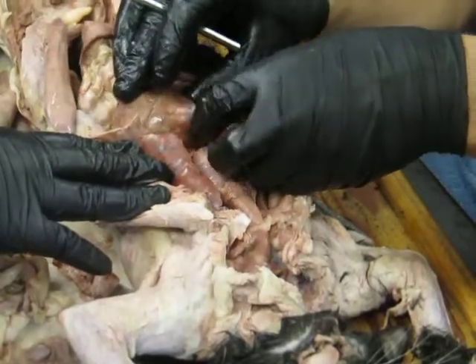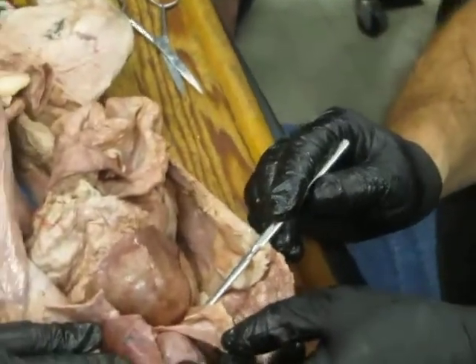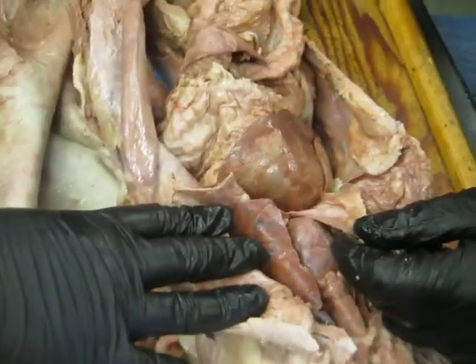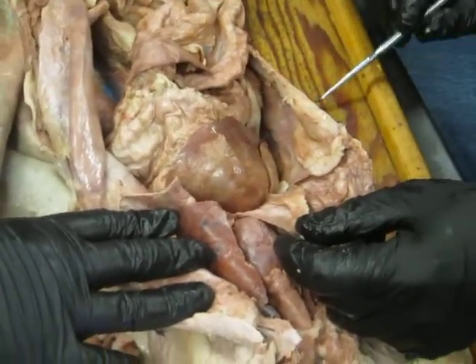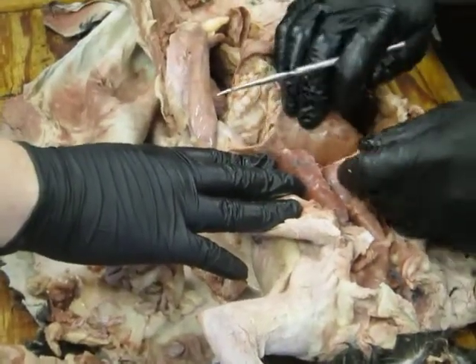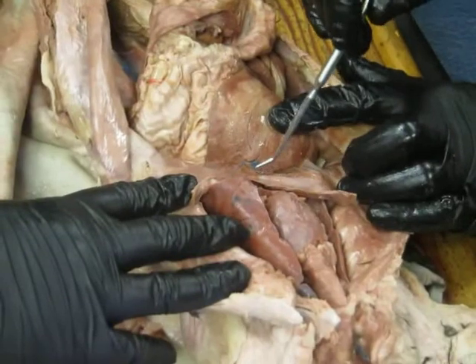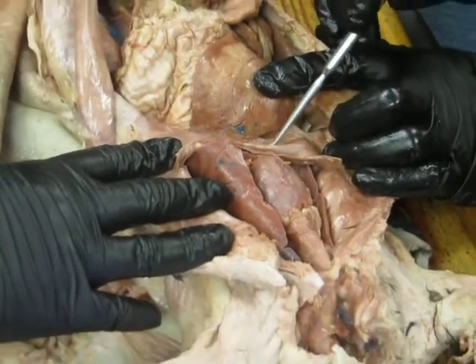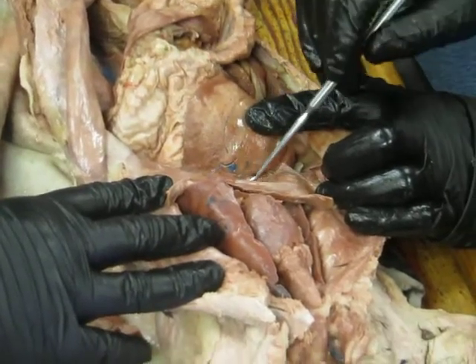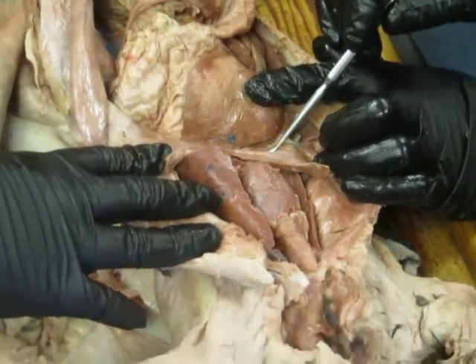Liver, and you can see this membrane that connects the liver kind of to the diaphragm and the ventral body wall right here, and that would be the falciform ligament. And I'm going to mention this because someone had asked me about it earlier. You'll see the term coronary ligament, and that's a little confusing because it's hard to figure out exactly what it's supposed to be. It's basically just the place where the visceral peritoneum covering the liver wraps around to the parietal peritoneum on the underside of the diaphragm. And so you can see there's a connection between the diaphragm and the liver that's basically made of a mesentery, and that is the coronary ligament.